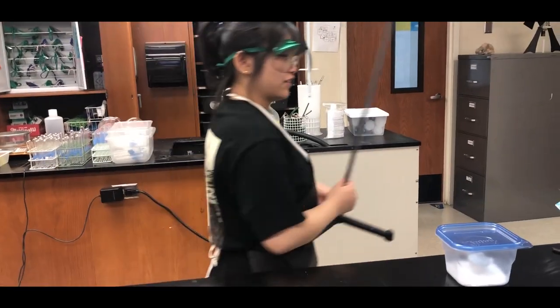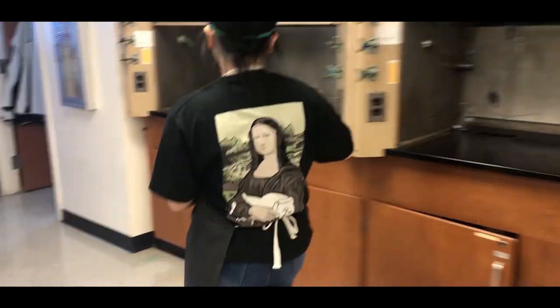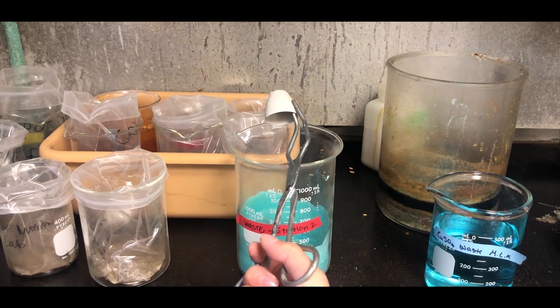Step 8, clean up as instructed. Dispose the compound and be ready for some calculations.